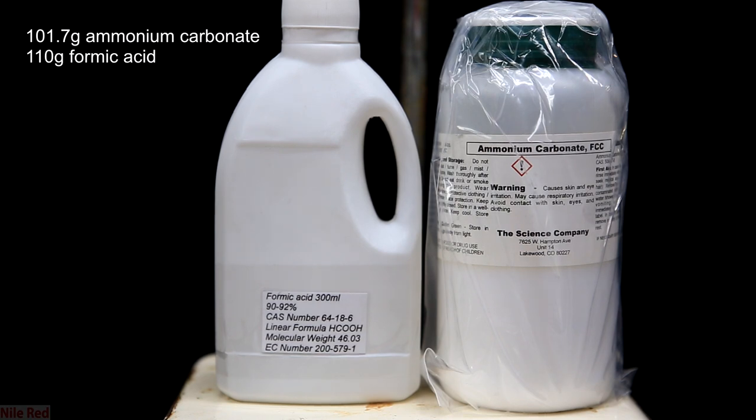Ammonium carbonate is also known as baker's ammonia and it's not supposed to be hard to find. I wasn't able to find it in any stores around where I lived, but maybe you'll have better luck.